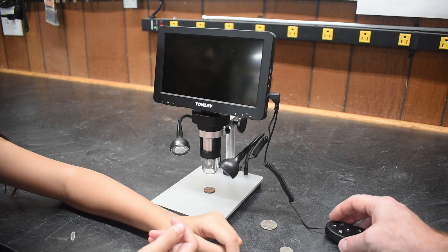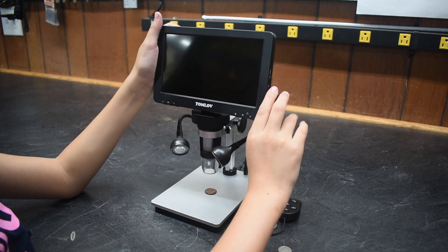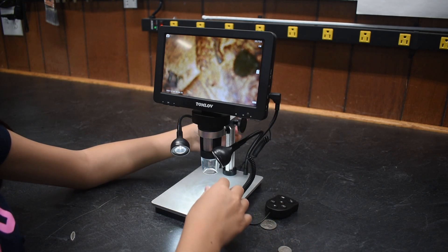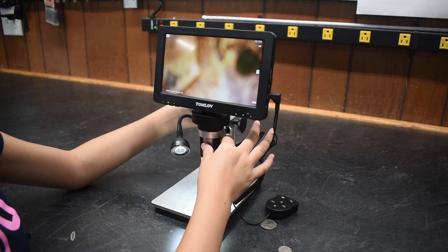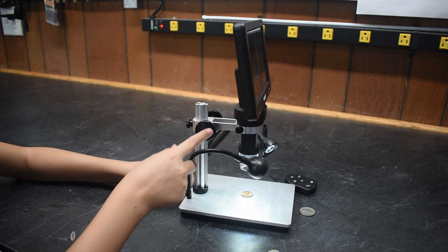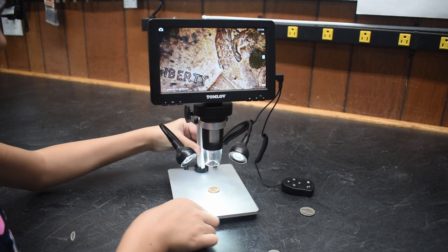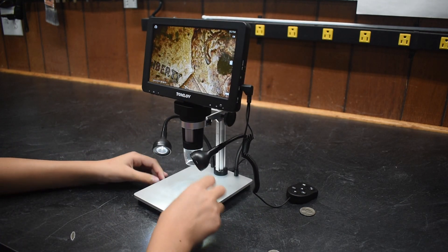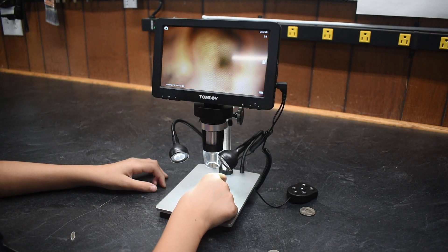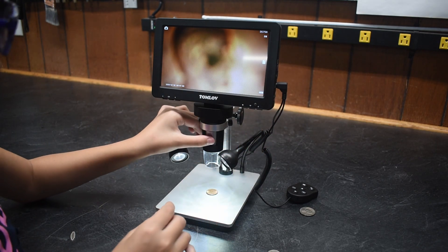That is very interesting. How do you turn it on? You just hold this. I am turning this — what does that do? It makes it go higher or lower. Now how do you focus it? You do this.